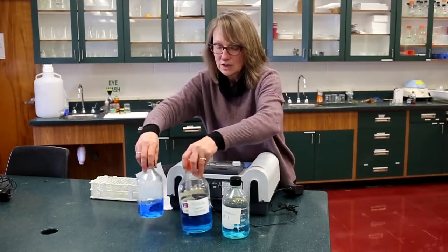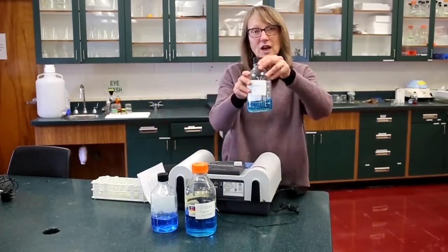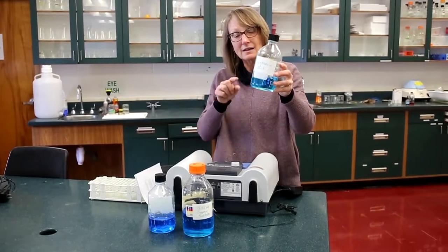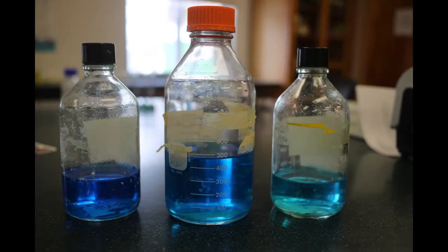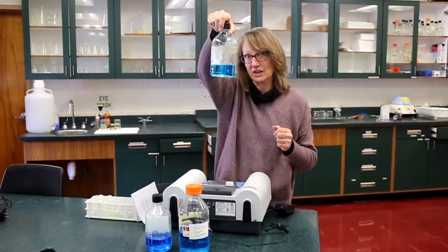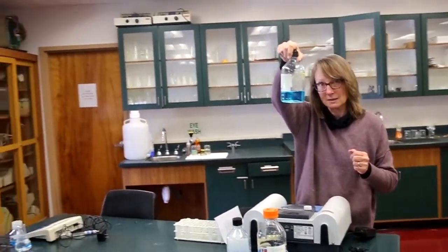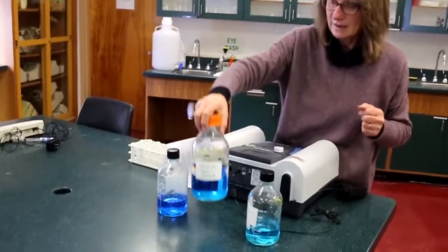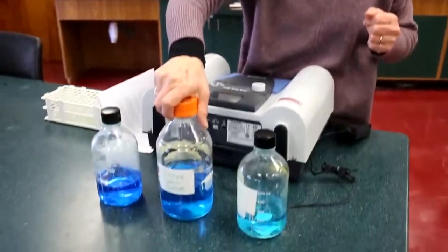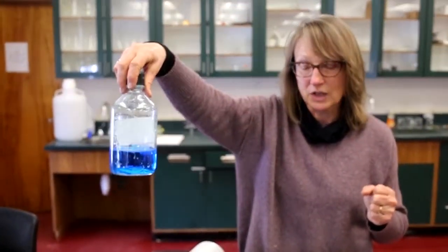is it obvious to you that the shade of the blue color is really the same, but that each of the bottles has a different concentration and the intensity of the color changes? So we'll talk a little bit more about that in a minute. Probably you could tell that this first bottle has the lowest concentration of copper sulfate because it's the palest blue, and perhaps this bottle has an intermediate concentration and this one has the highest concentration.